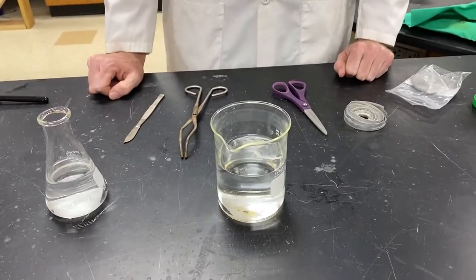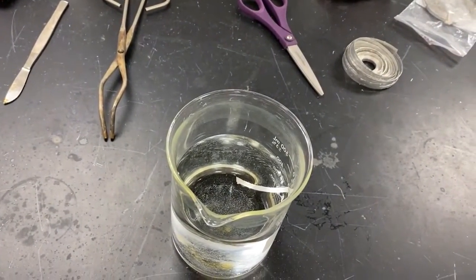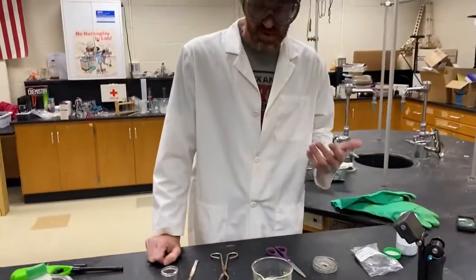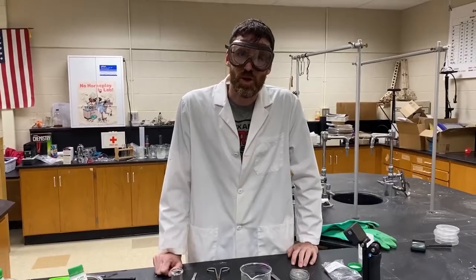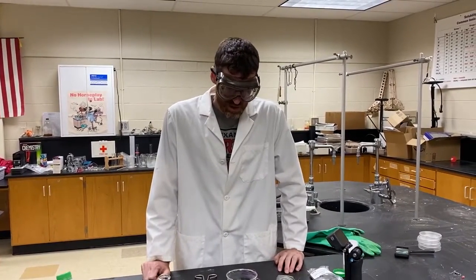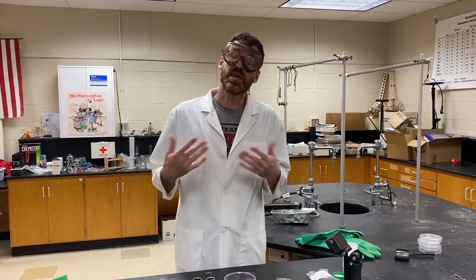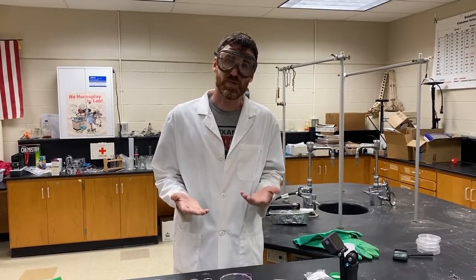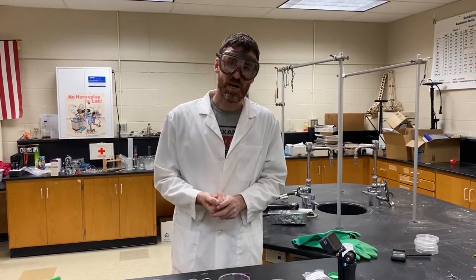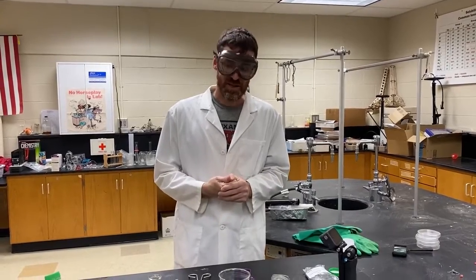Waiting. I know what you're saying. That is super lame. It's not doing anything. Well, it actually is oxidizing, and if I had a piece of it that had been oxidized in the water for a longer period of time, you'll notice it'll blacken and that it will slowly corrode or change in colors, indicating that we had a chemical change. When you have a change of colors, a chemical change has occurred. So the magnesium will oxidize, taking oxygen from the air or the water.